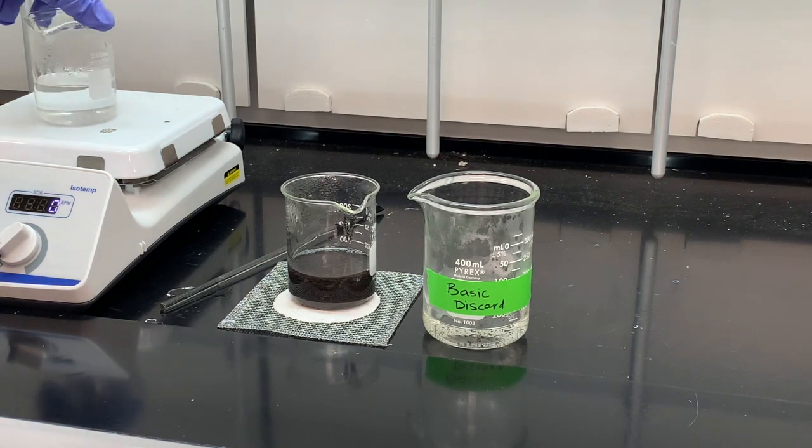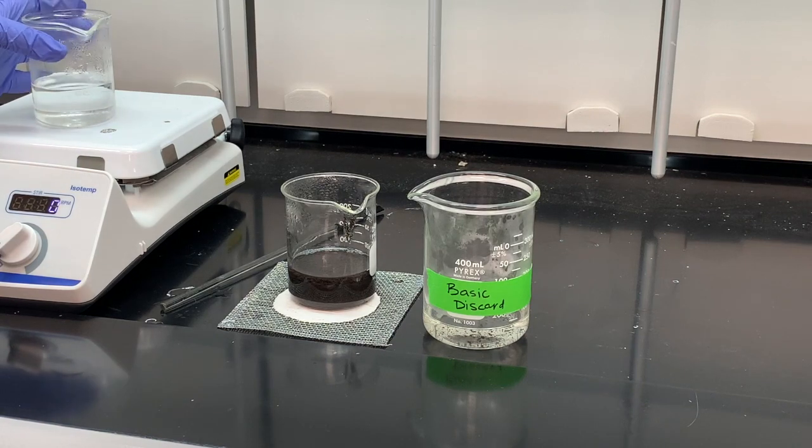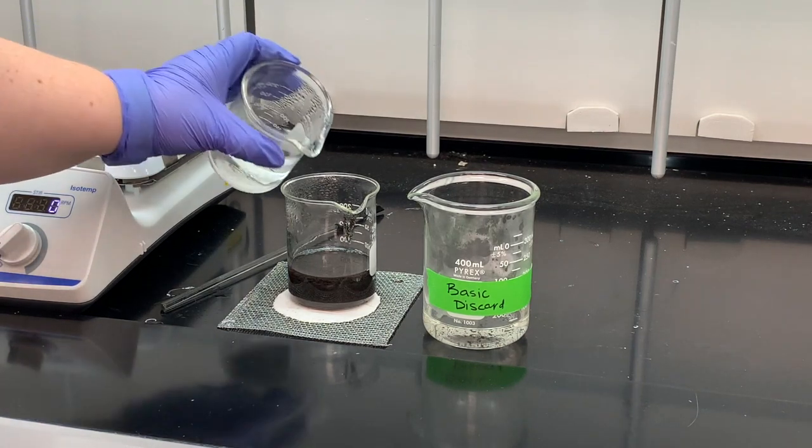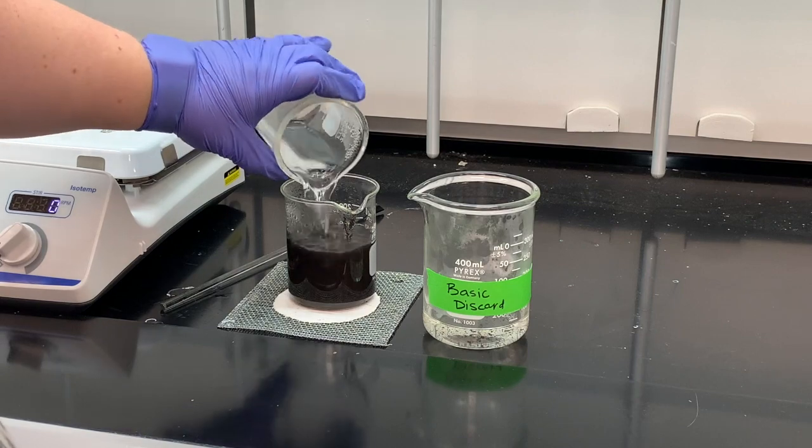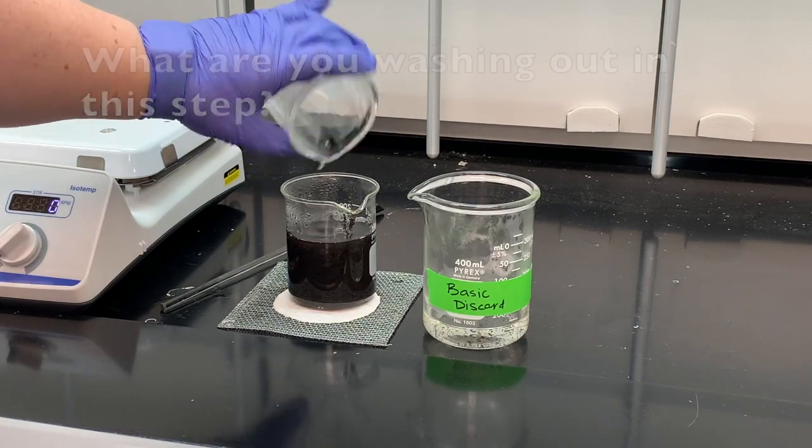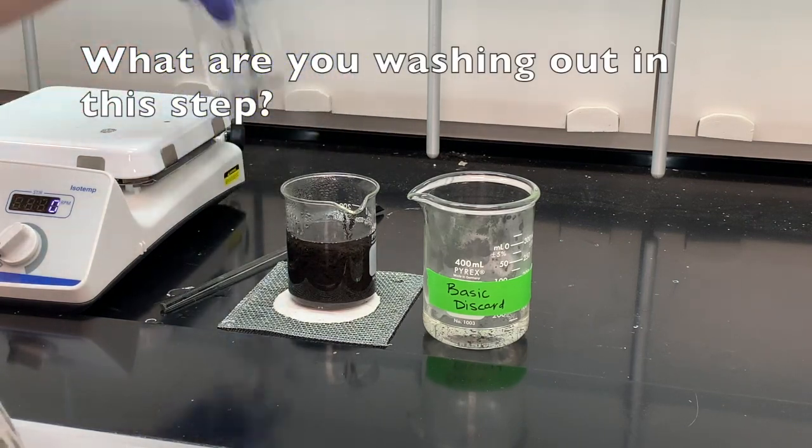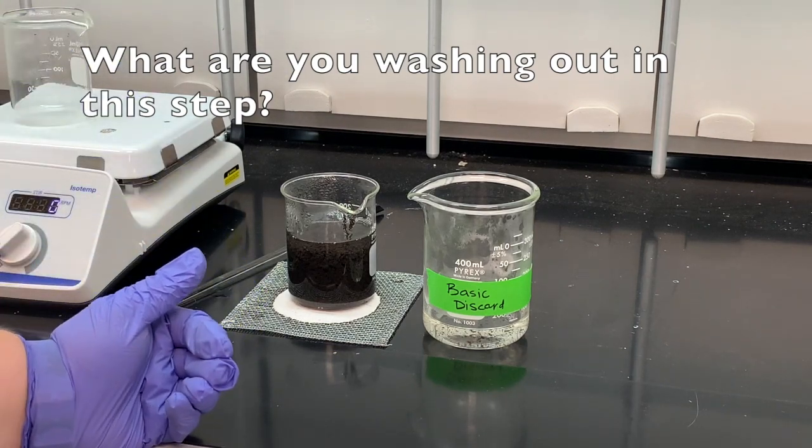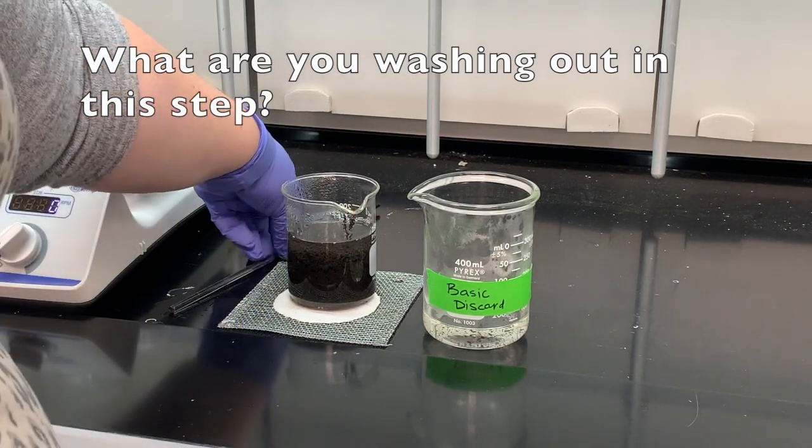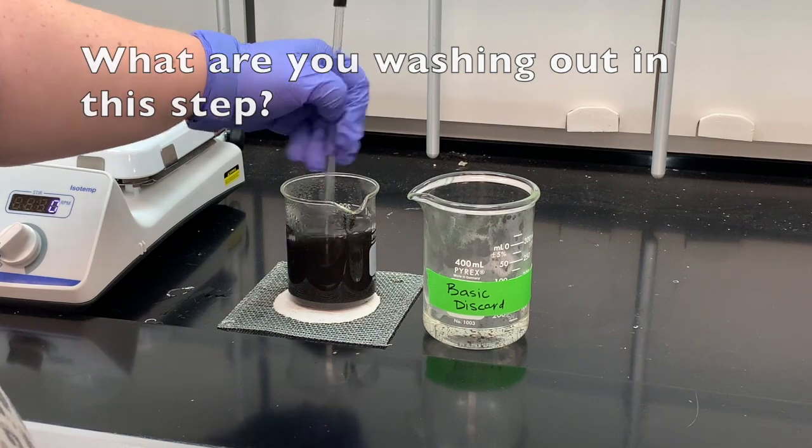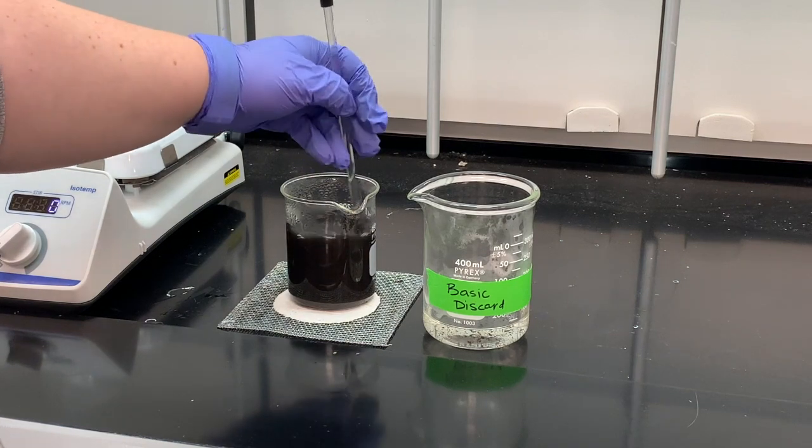Okay, so now we're going to add our very hot distilled water. That was our other beaker that was heating up, and this is just as a wash. So from your reactions, you want to figure out what you are washing out with this step. So what is in this solution that we want to get rid of?